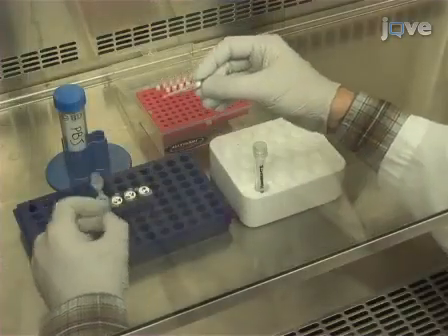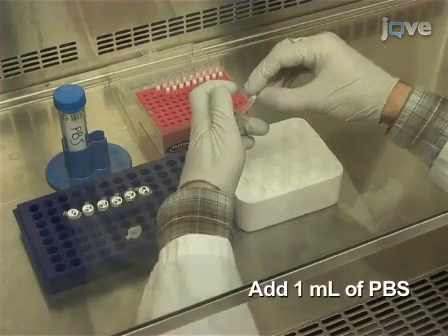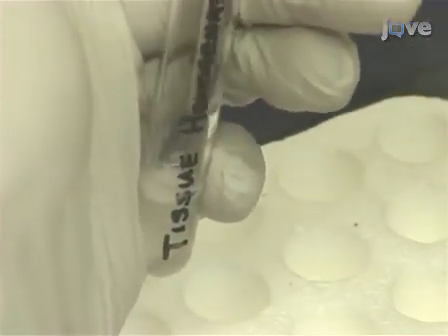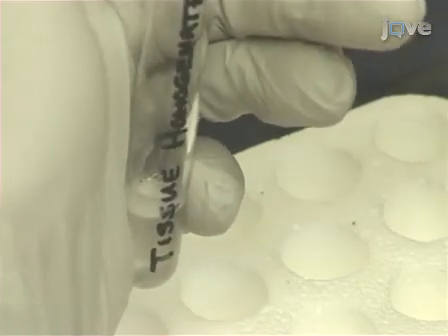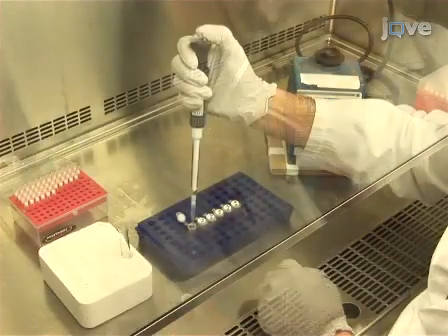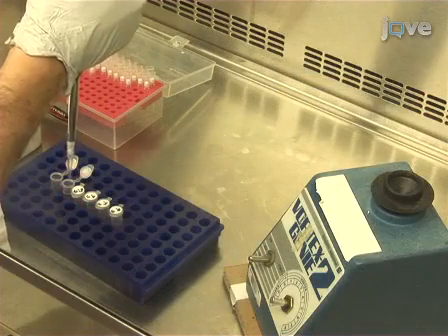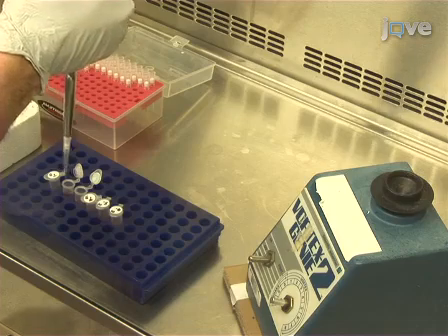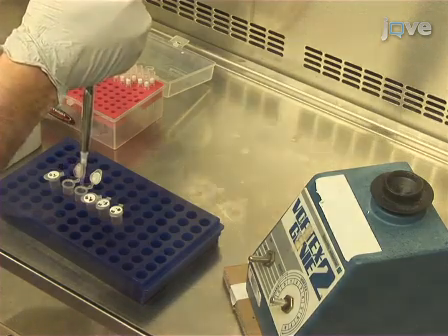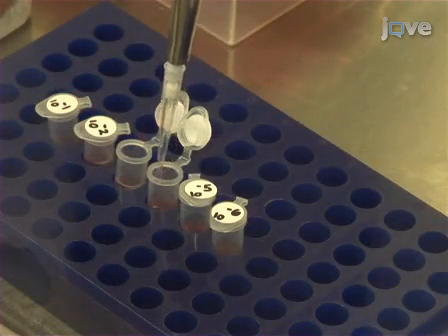Transfer the samples to a 5 ml polystyrene round bottom centrifuge tube and add 1 ml of PBS. Use a tissue homogenizer to homogenize the tissue and release the viral particles. Then, make 1 in 10 serial dilutions of the tissue homogenate viral suspension in serum-free media by transferring 100 microliters of the tissue homogenate viral suspension to 900 microliters of serum-free media and repeating as necessary.